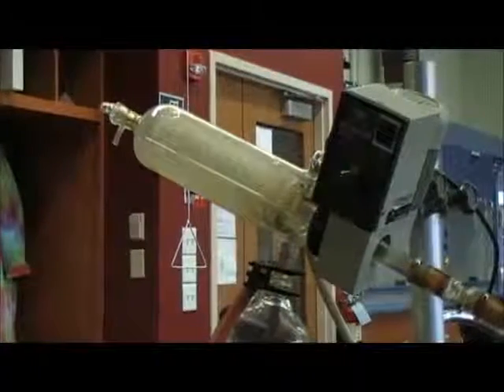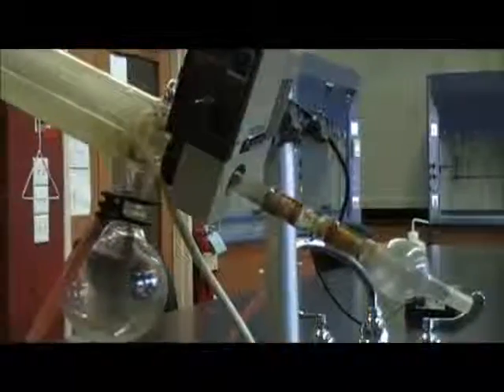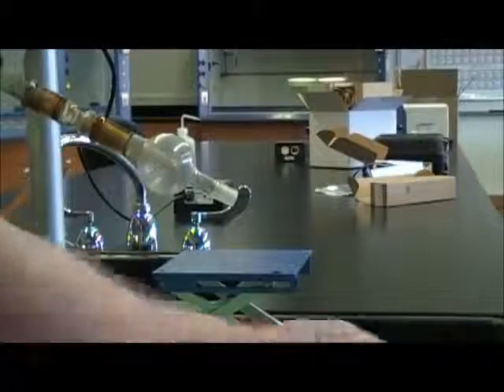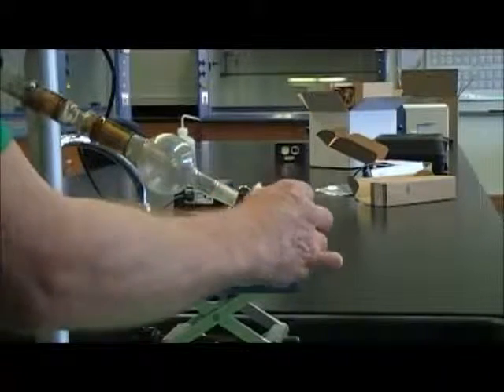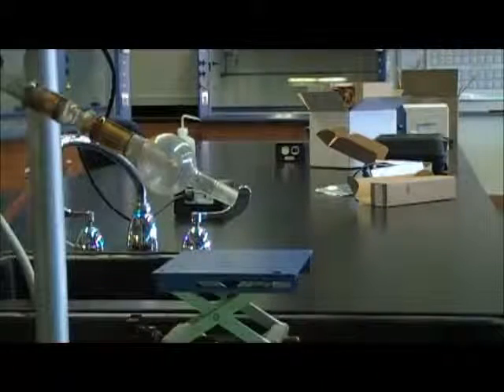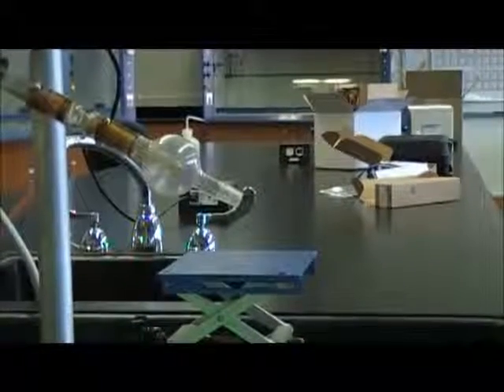We will attach a round-bottom flask down here and the round-bottom flask has our sample in, and I'm not going to attach it quite yet. That will be where the flask will go.